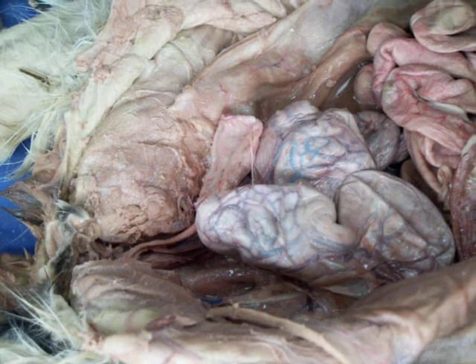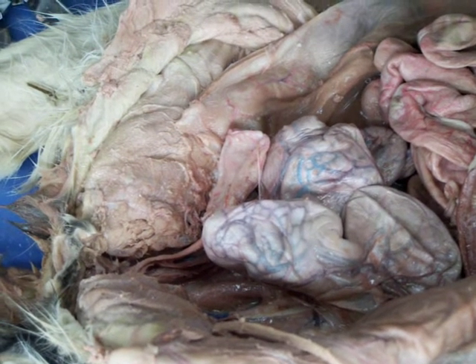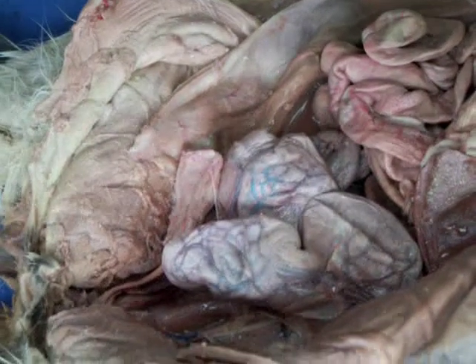Oh, I think I see an eyeball maybe. Was that an eyeball? Was that his head? Do you see what I'm saying? Her head? You can see a lot better than I can. Could there be an eyeball? Maybe? Go soak it in some water for a while. I'm probably just seeing little things. Looks like a chicken egg. You should cut open the other side.